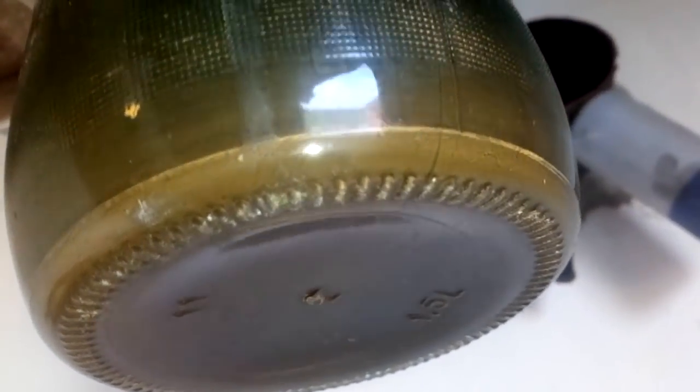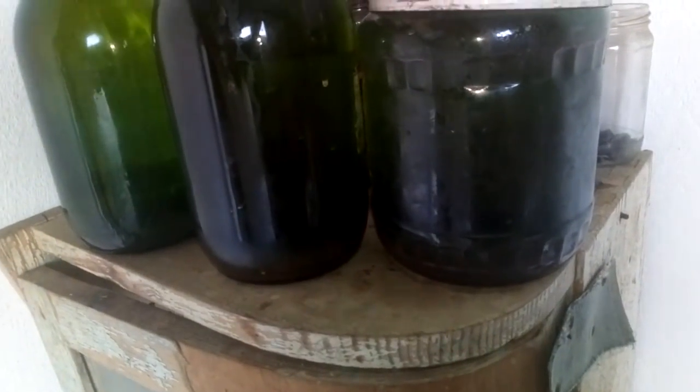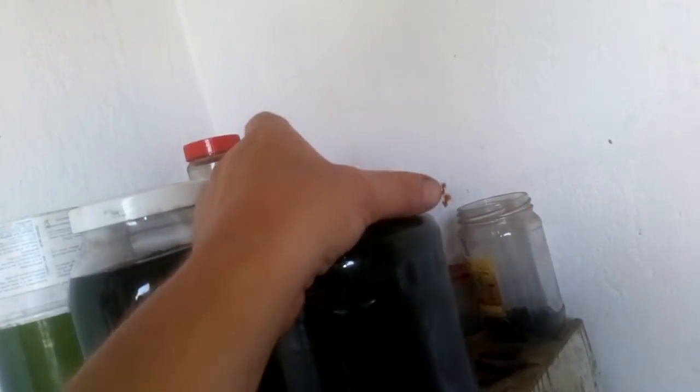Okay, this is the jar from it and we got some gold here. See that? We got some precipitation and everything has settled down — looks like a very clear solution. It's a lot of solution because I added too much urea. These two jars are actually from my waste filter — I got a full jar of filter material and I processed this for gold. And I got some dirty drop here, and some nice drop here.